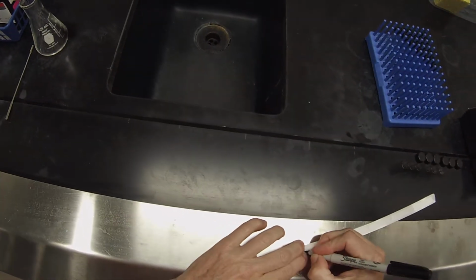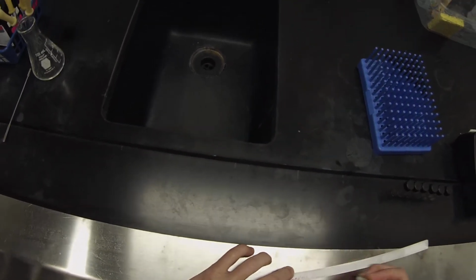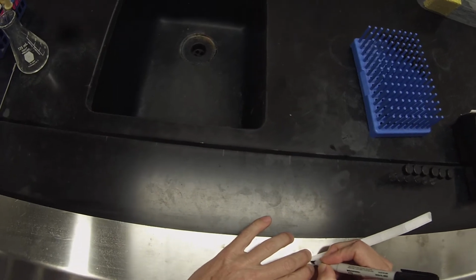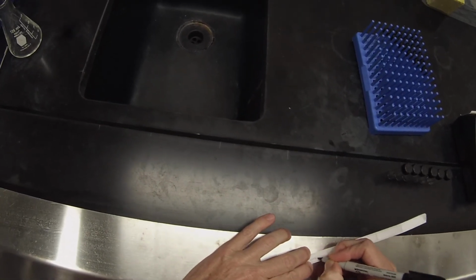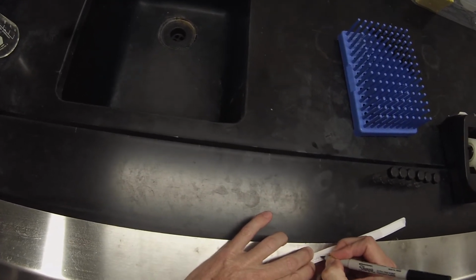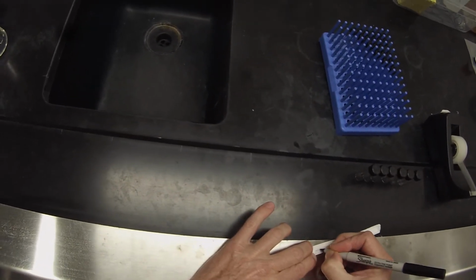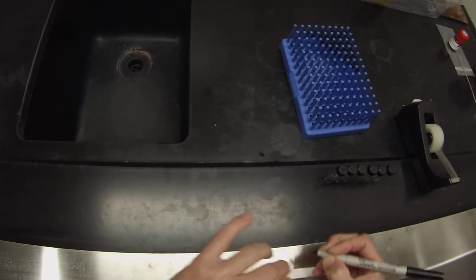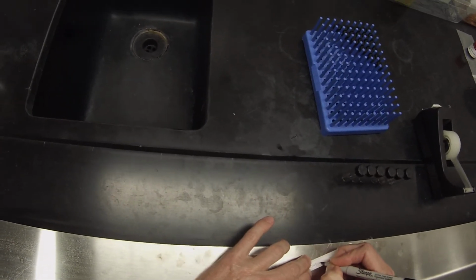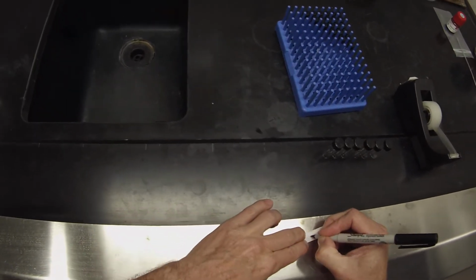So I'm going to go ahead and label up 6 vials so that we can take these to the balance and prepare our standard samples. So we've got linalool, we've got 2-phenylethanol, we've got 2-phenethyl acetate, we've got guaiacol, we've got eugenol, and we've got vanillin.